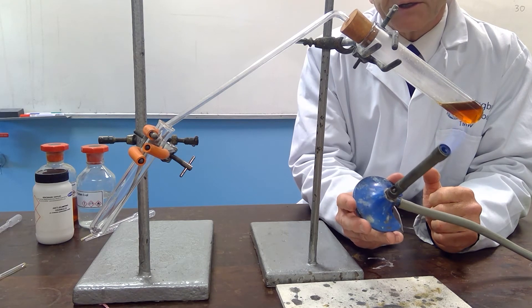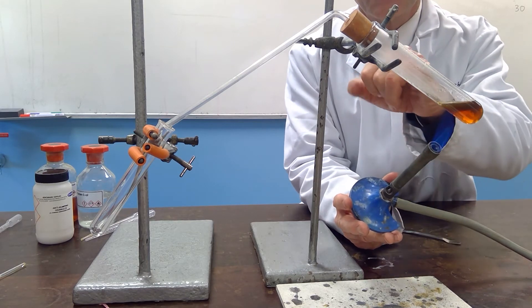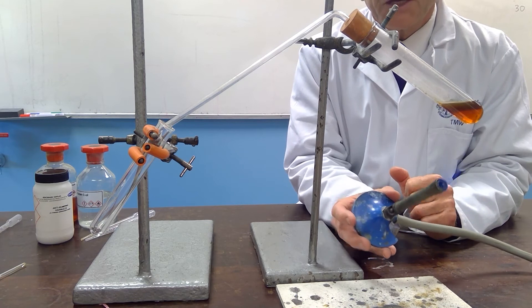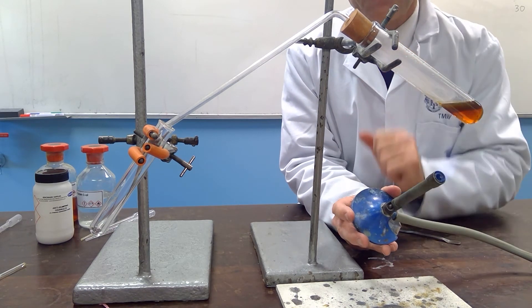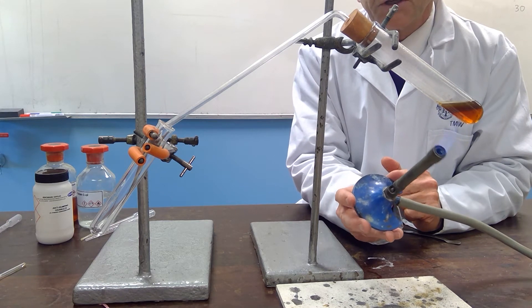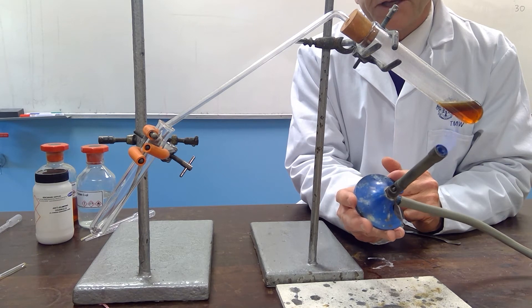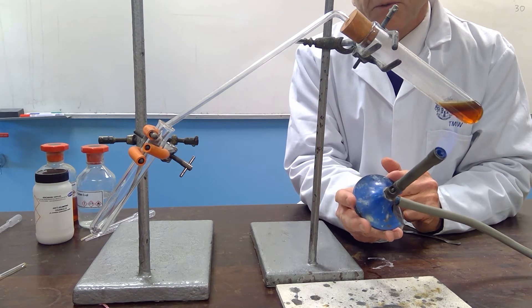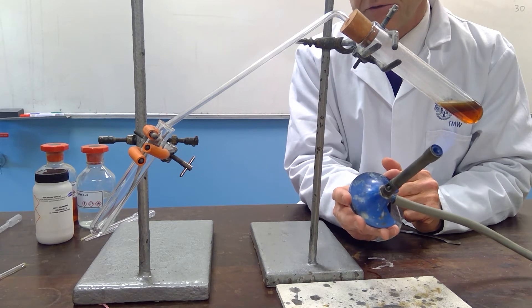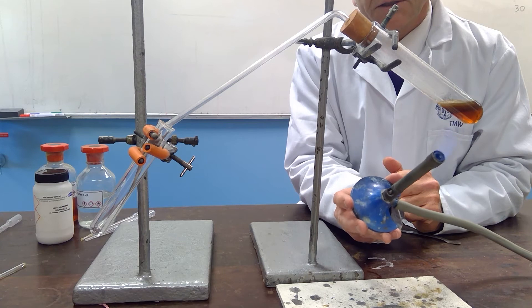Once again, the orange color is going green, and you can already see that the vapor is starting to condense at the top of the tube. So, as we heat, you can see that there is some liquid starting to condense and falling back into the boiling tube. However, if I continue to heat, some of the gas will find its way into the delivery tube and will run down, and we will start to get a distillate.